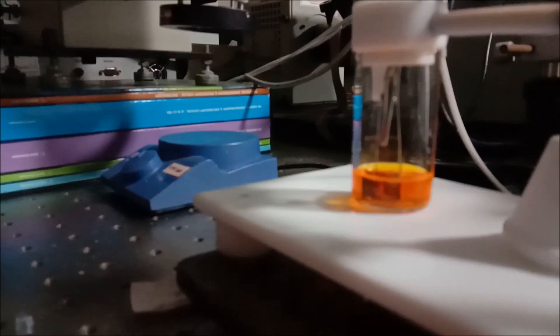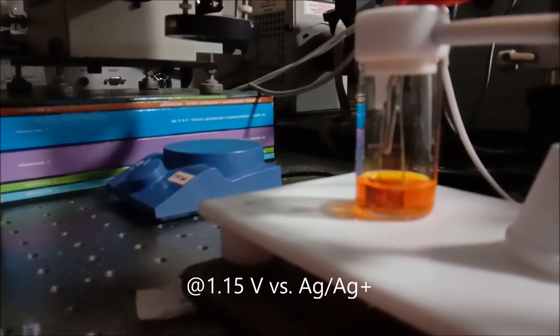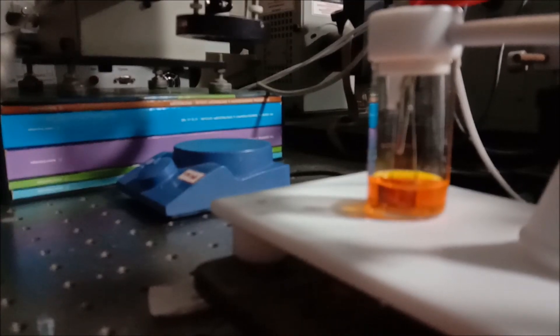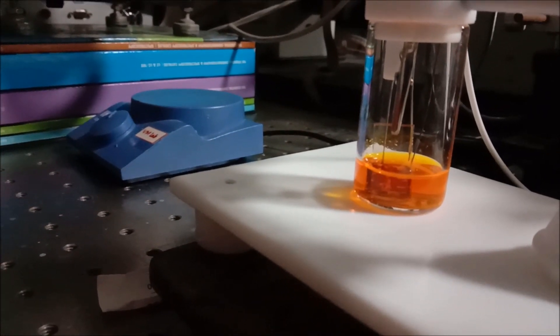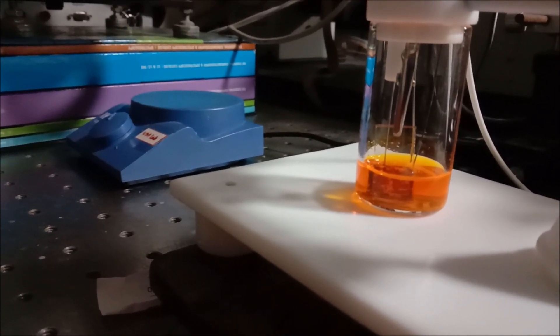The darkness or blackness of the deposited material is being faded away and it is happening at a particular voltage. We are performing cyclic voltammetry in a particular voltage window. Now you can see dark color of the material, now it is fading away, but there is a problem in the homogeneity of the film. It somehow looks like the human ribs.